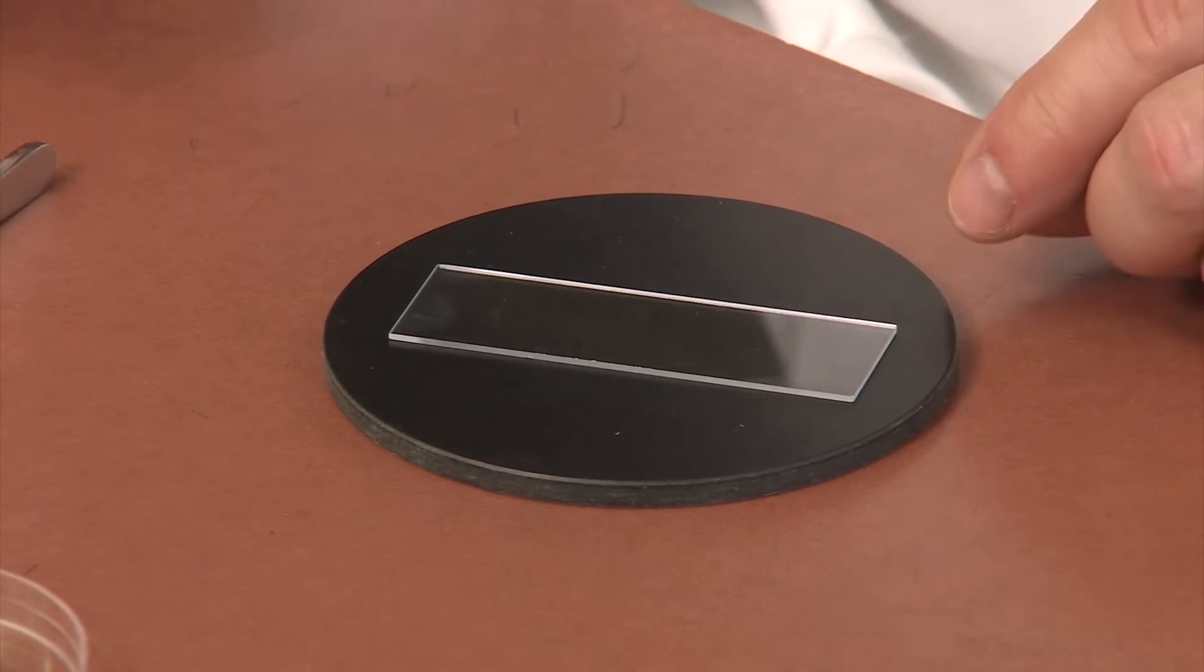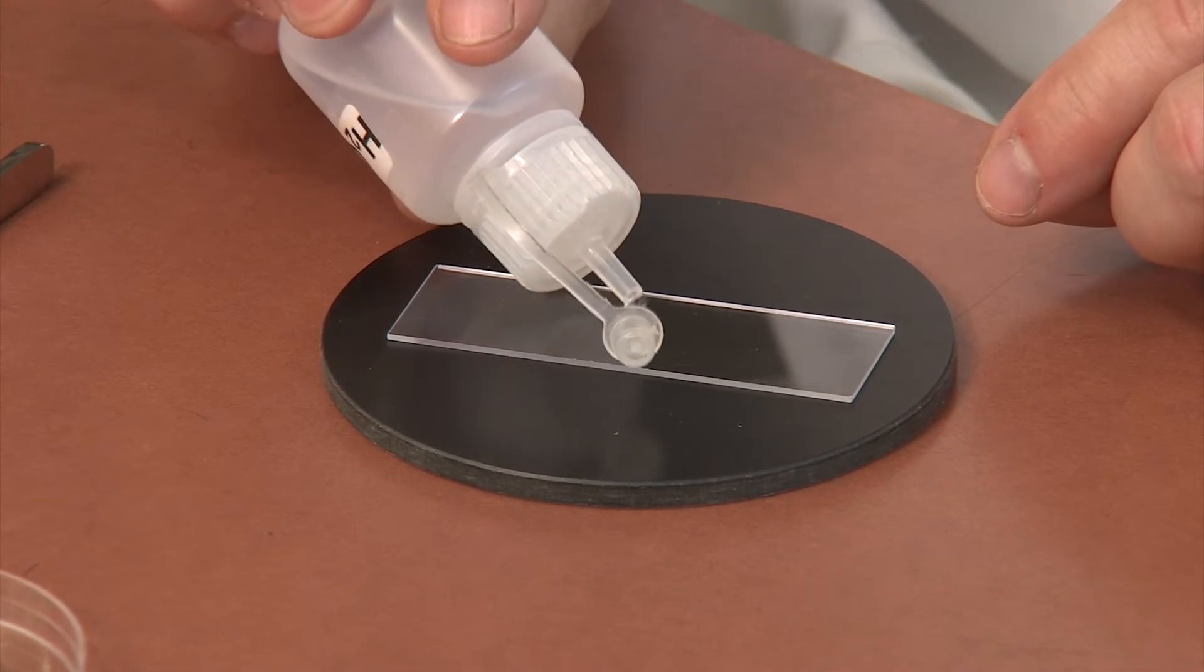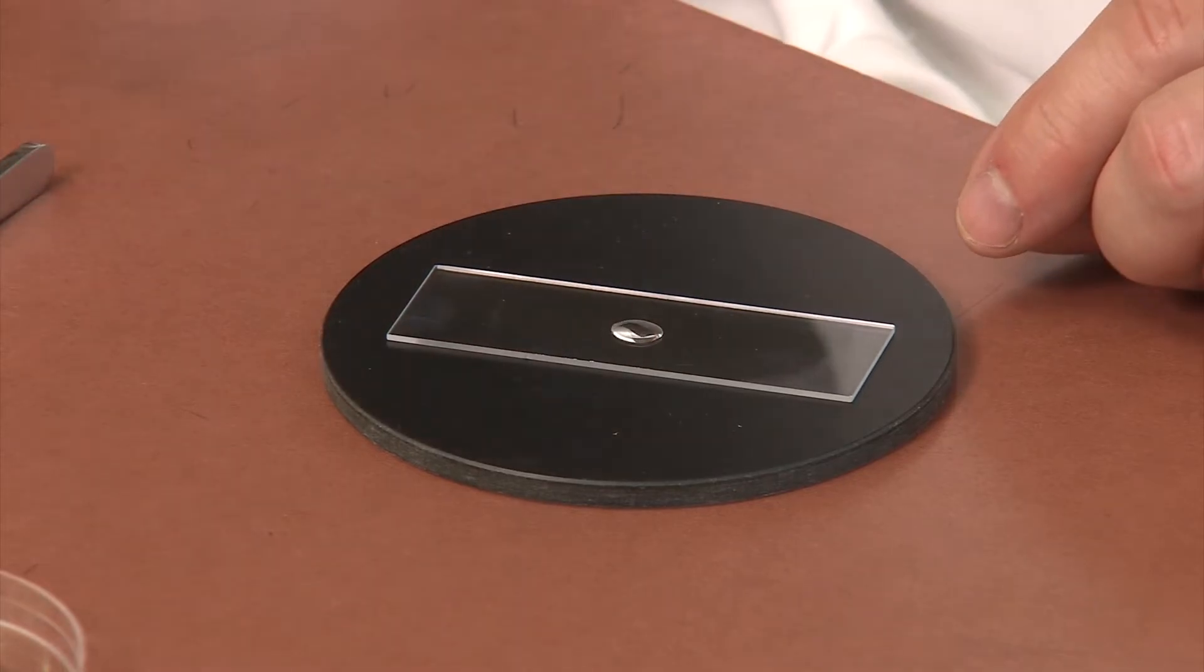Place a clean microscope slide on a flat surface. Add a drop or two of water to the center of your slide.